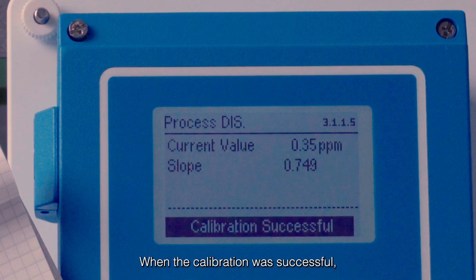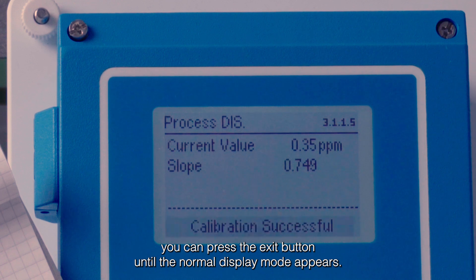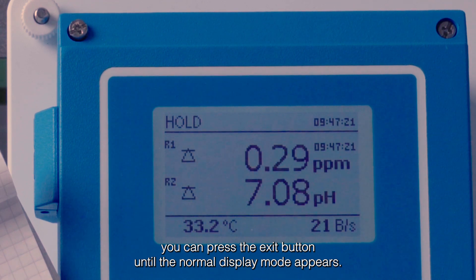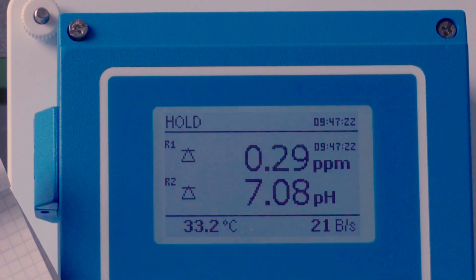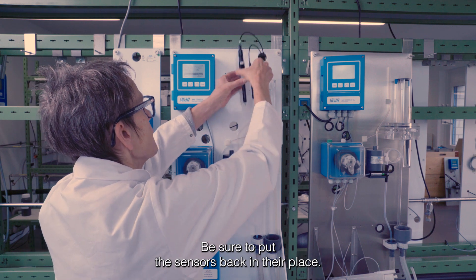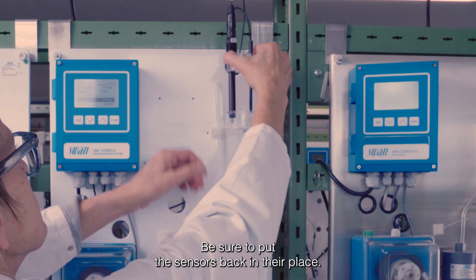When the calibration was successful, you can press the Exit button until the normal display mode appears. Be sure to put the sensors back in their place.